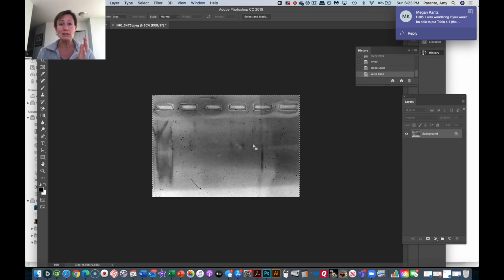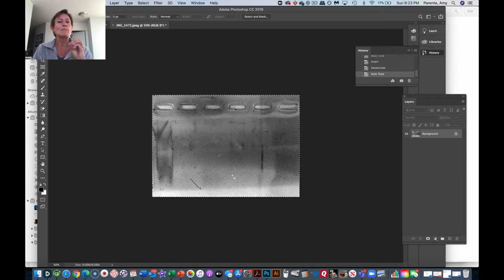I want you to label the lanes, and then label, even if we don't see what we'd expected to see, let me know what you expected to see. So if this was our cleared lysate, what did we expect to see in here? Where do you think you'd expect to see this?